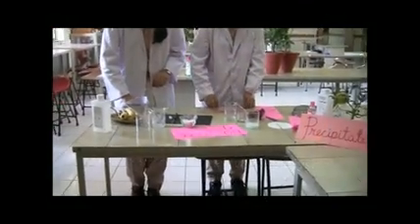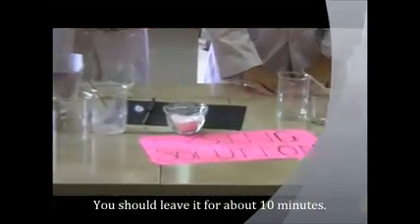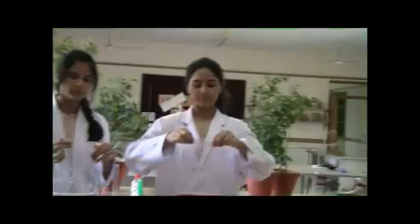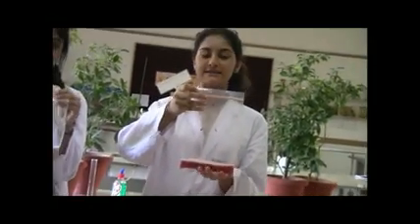Once you have mushed it with the lysis solution, you should leave it for about 10 minutes. This is the mashed strawberries along with the lysis solution. The lysis solution helps in breaking the cell membrane and the nuclear membrane. After you're done with this, the chromatin material comes into the solution.